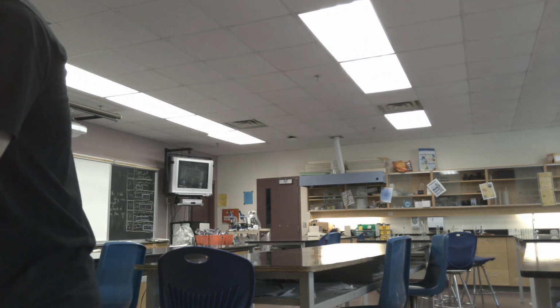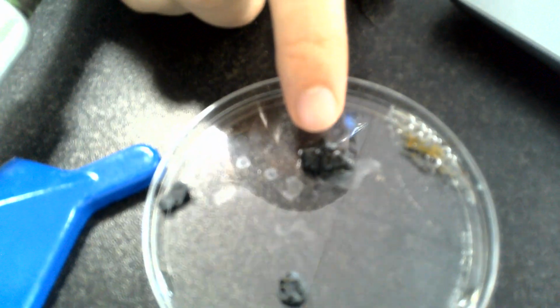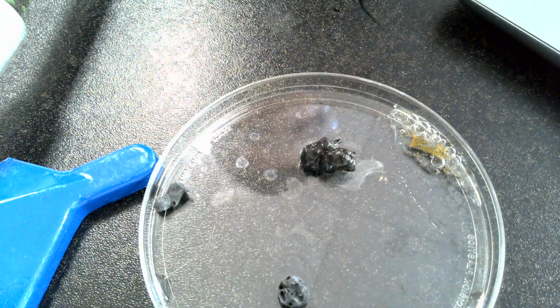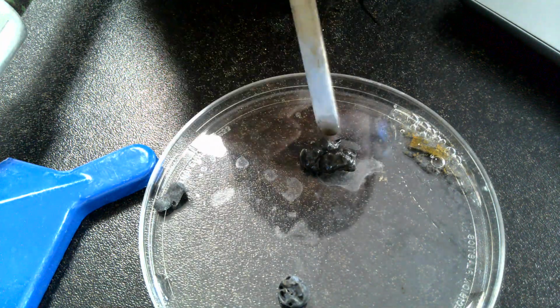You remember our previous zinc and what it looked like. So what we now have, take your observations, is this lovely zinc right here. It was the one we were just working with. It is no longer that nice dull gray zinc that we saw before.